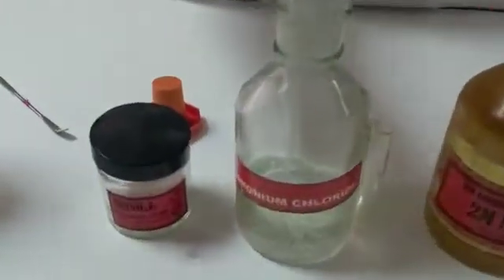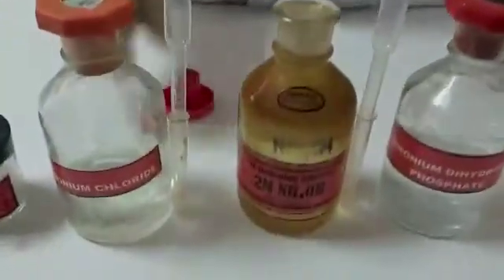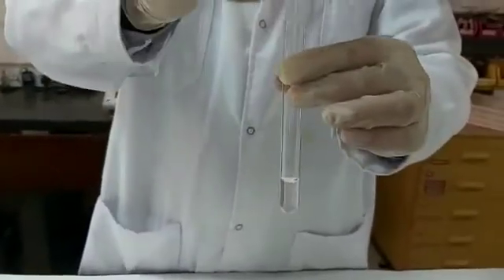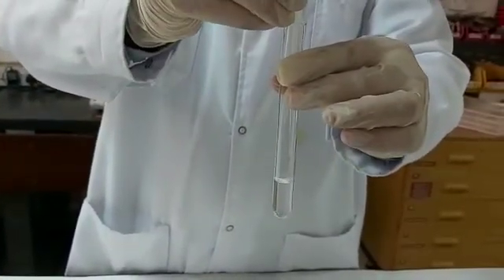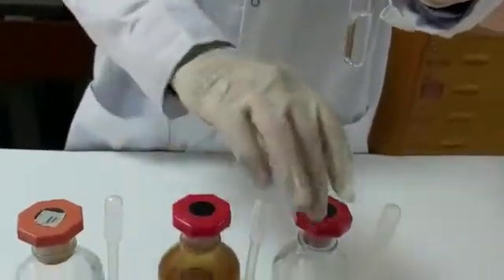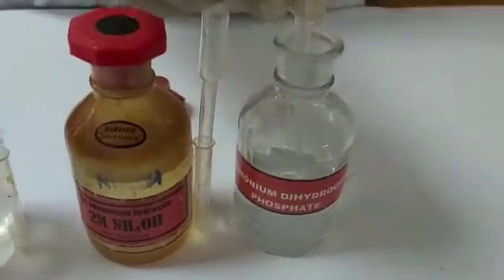After that we will be adding drops of ammonium chloride solution, then drops of ammonium hydroxide solution, and finally we will be adding ammonium dihydrogen phosphate.